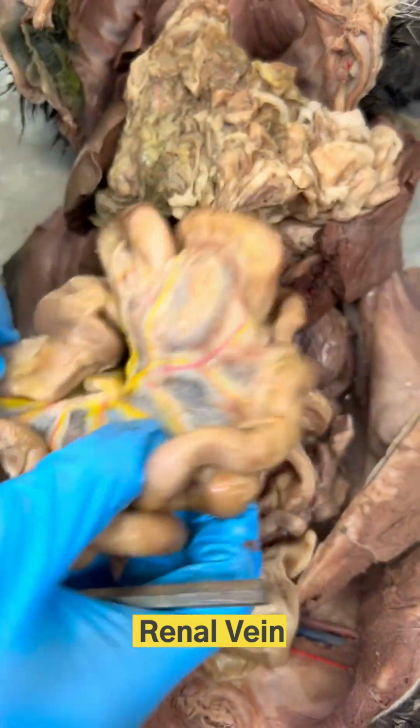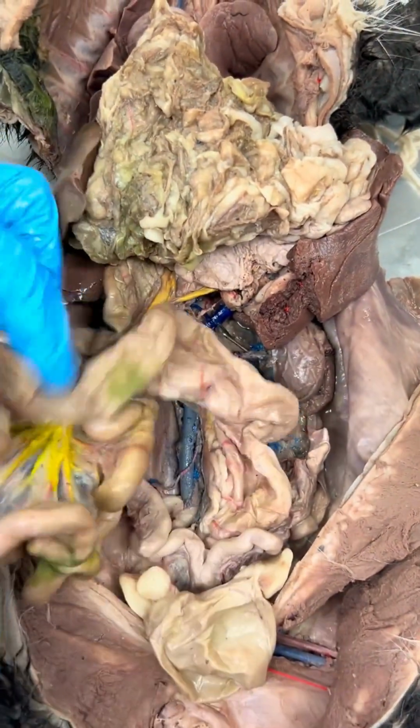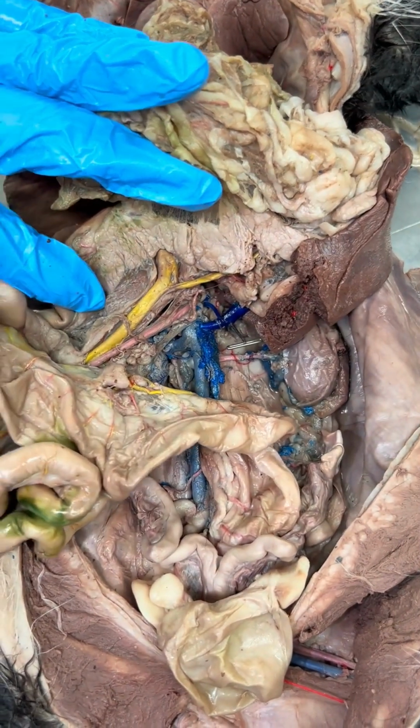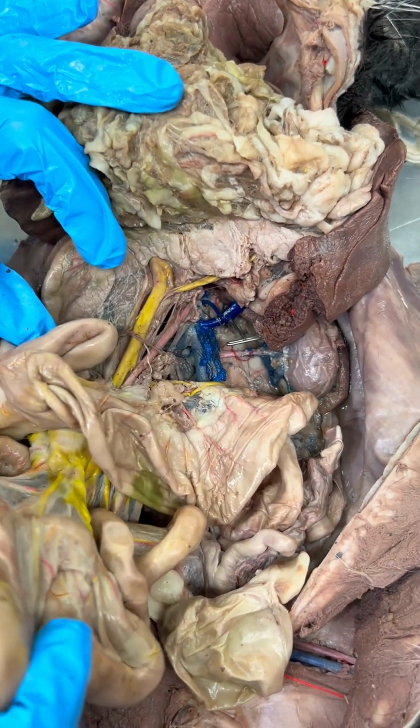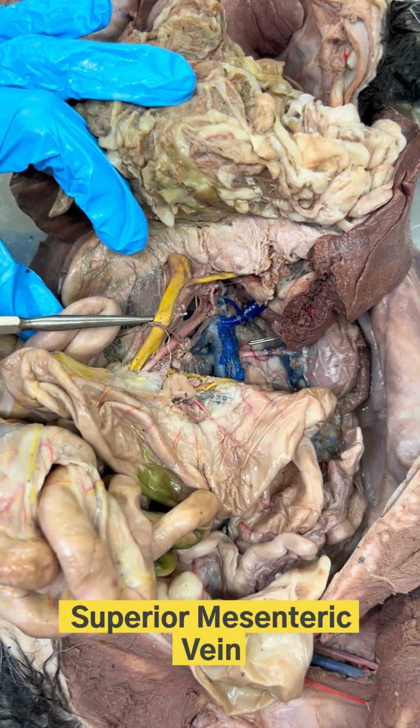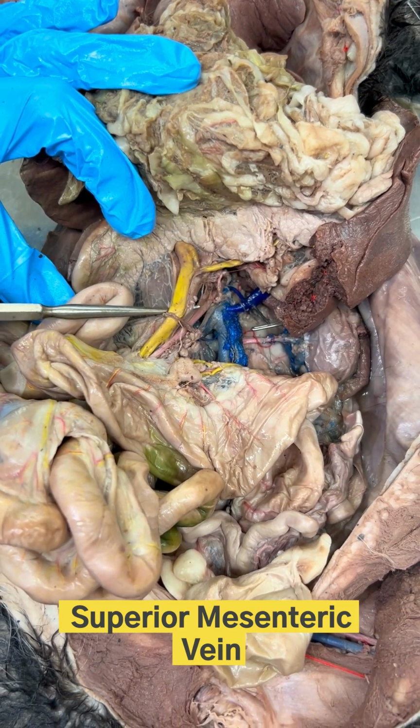These cats are then also injected with yellow latex to preserve the blood vessels that belong to the hepatic portal system. So, because this is all the small intestine right here, that makes this yellow vein right here the superior mesenteric vein.